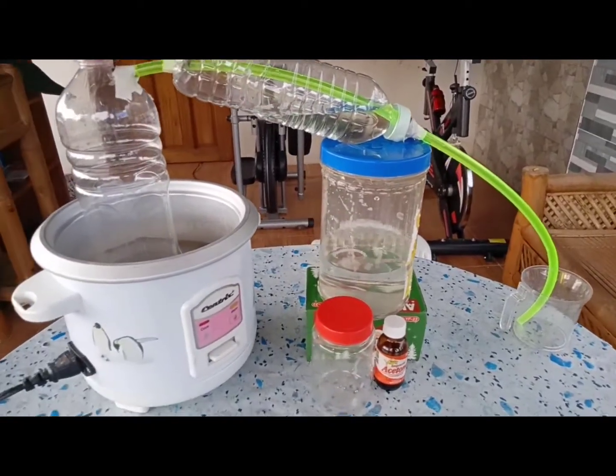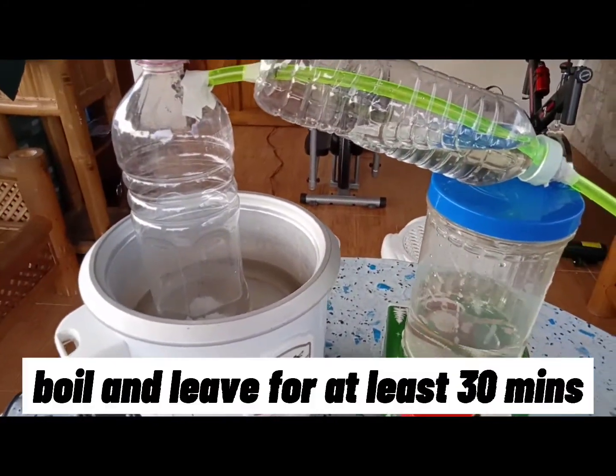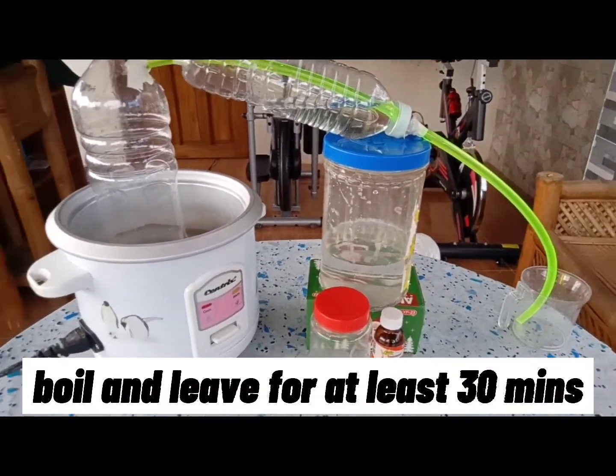And finally, now we will let it boil and leave it for at least 30 minutes.